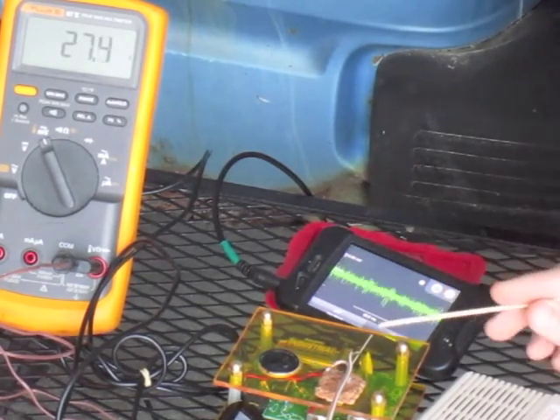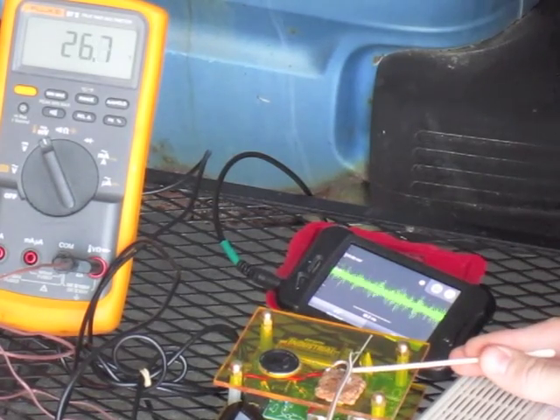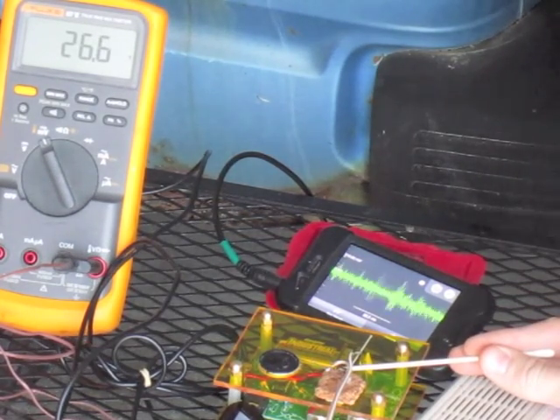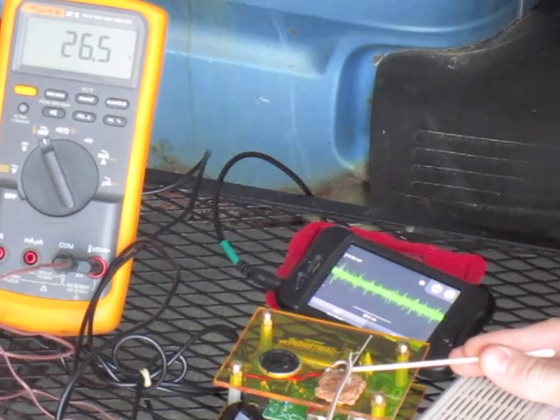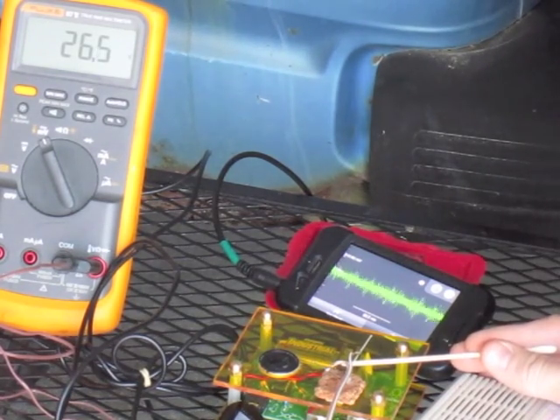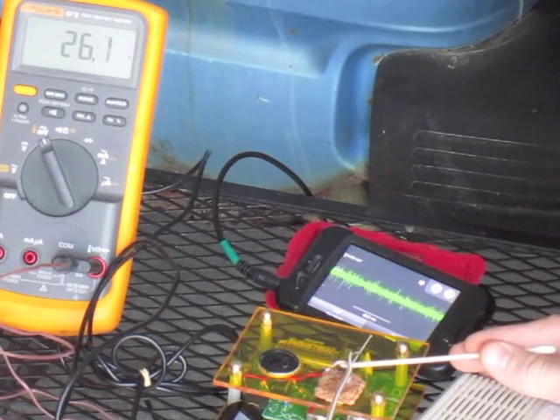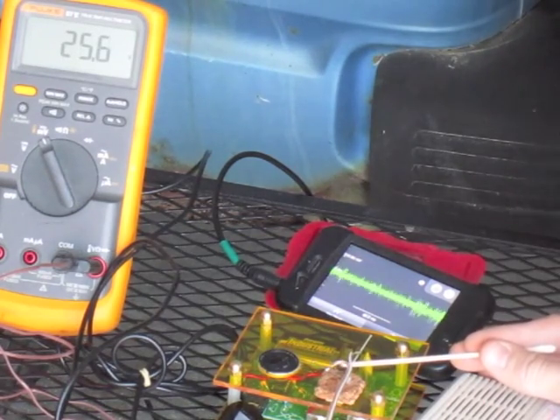Let's watch the oscilloscope on my iPhone. As I manipulate the leg with the Q-tip, as the temperature drops to around 20 degrees, you will notice the amplitude of the activity is decreasing and decreasing.